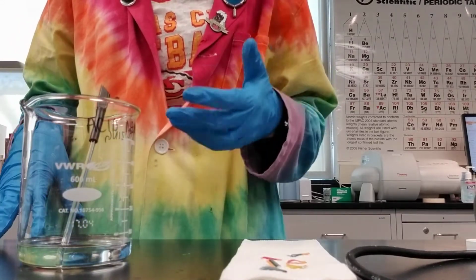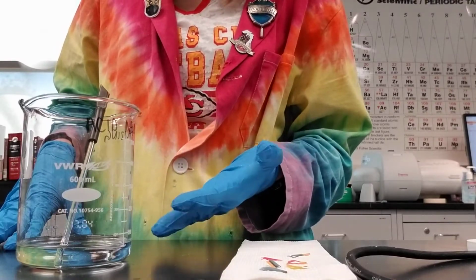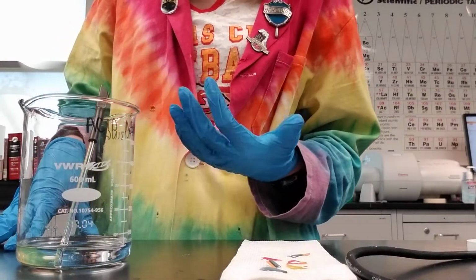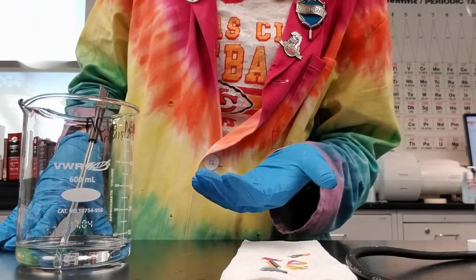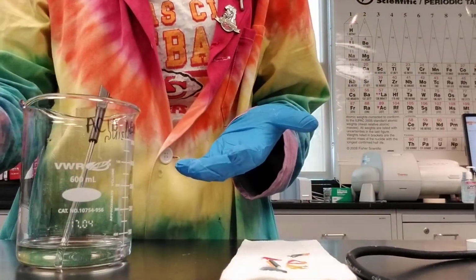depending on the chemicals you're given. You could be given some base solution like sodium hydroxide to neutralize, and if you're doing that, it works exactly the same way as it does for neutralizing the basic solutions in the other video.